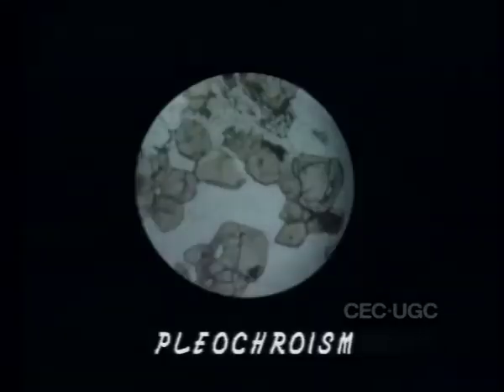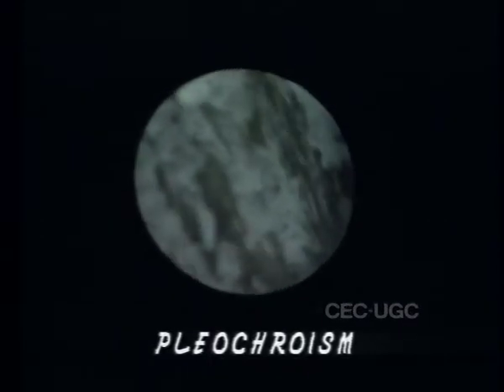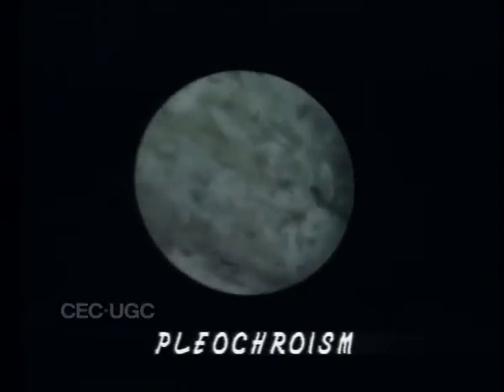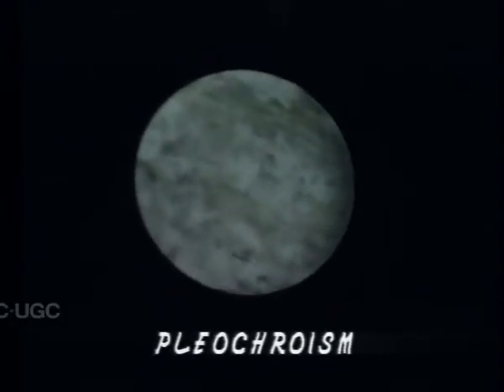There is a difference between colored isotropic and colored anisotropic minerals in terms of absorption characteristics. In isotropic minerals, color does not change on rotating the stage, but in anisotropic minerals, either the shade or the color itself is liable to change when the stage is rotated. This property is called pleochroism.